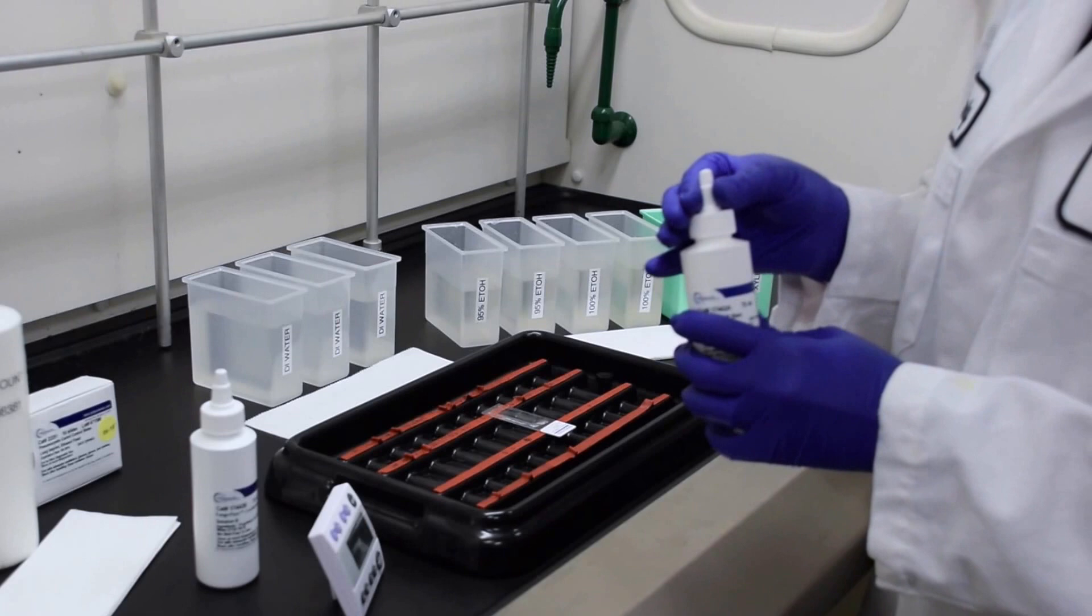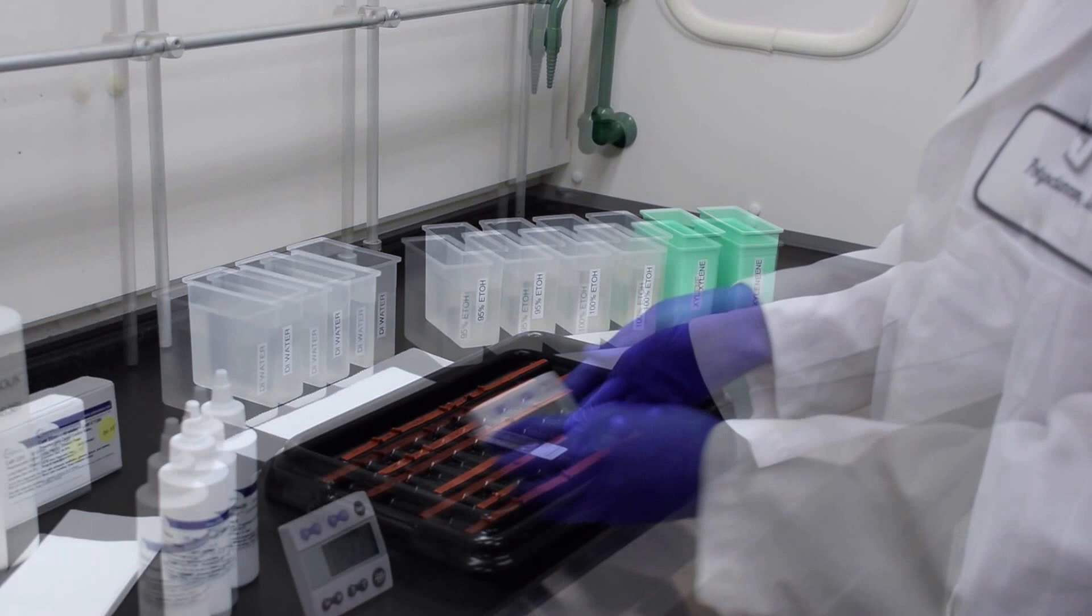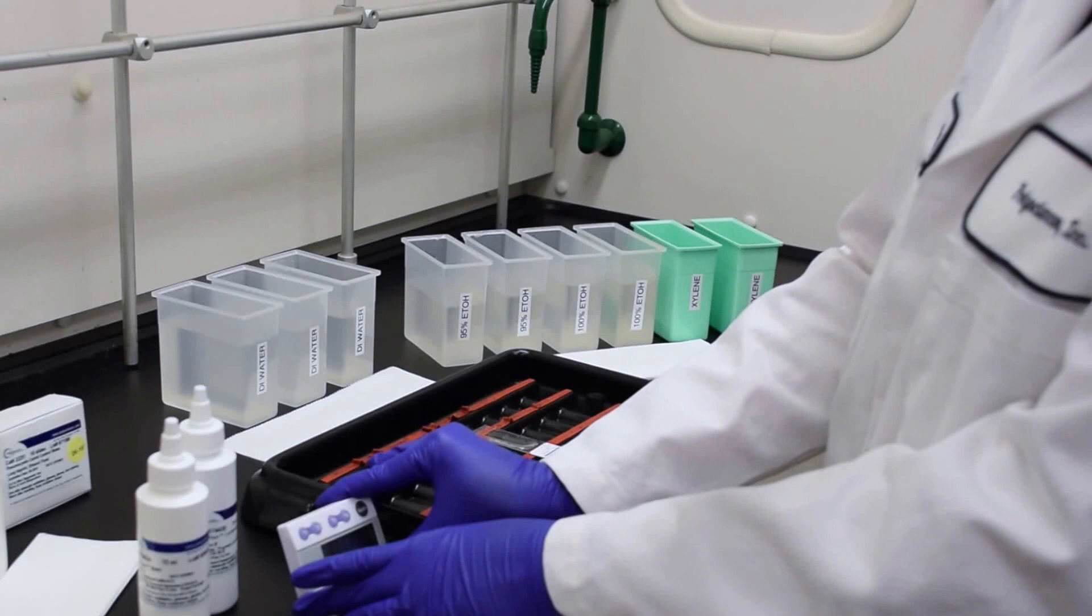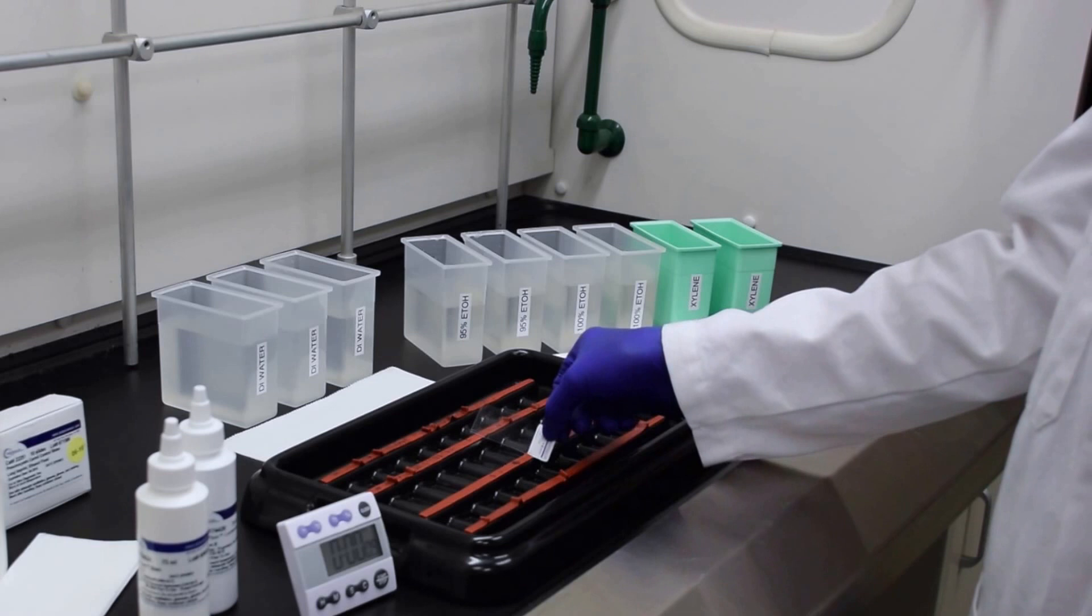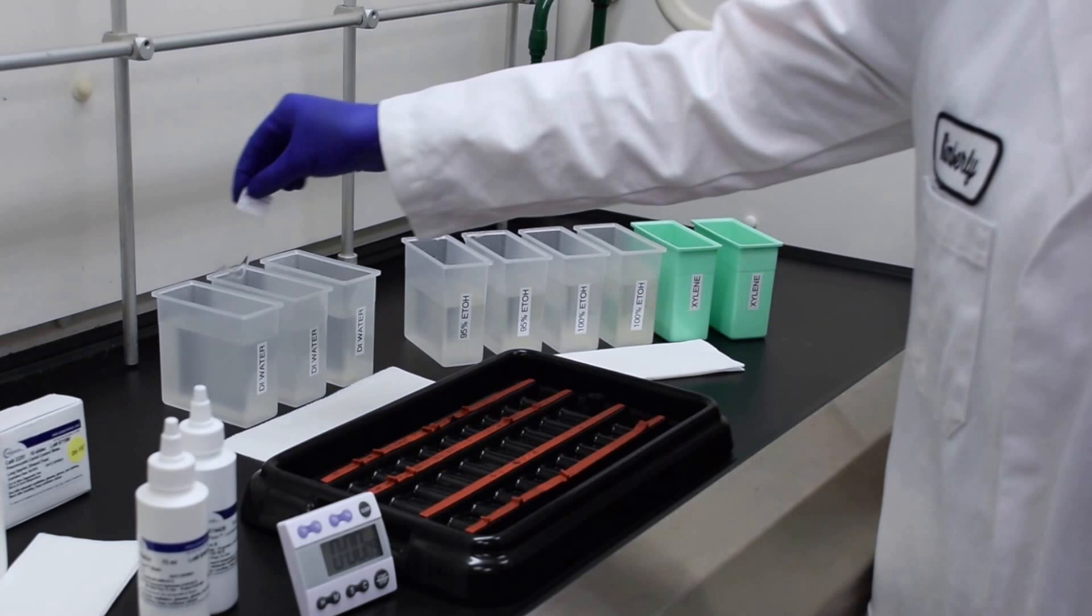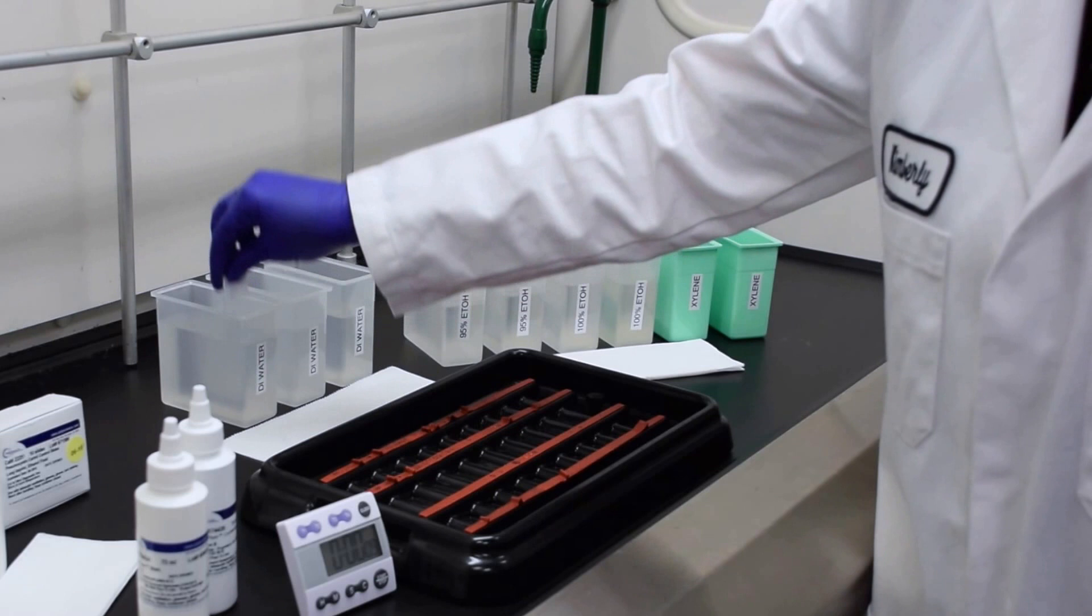Stain for one minute. Once your one minute is over, drain solution A very gently off the slide and place in DI water. The slide can be gently dipped in two changes of DI water for about 15 seconds each.